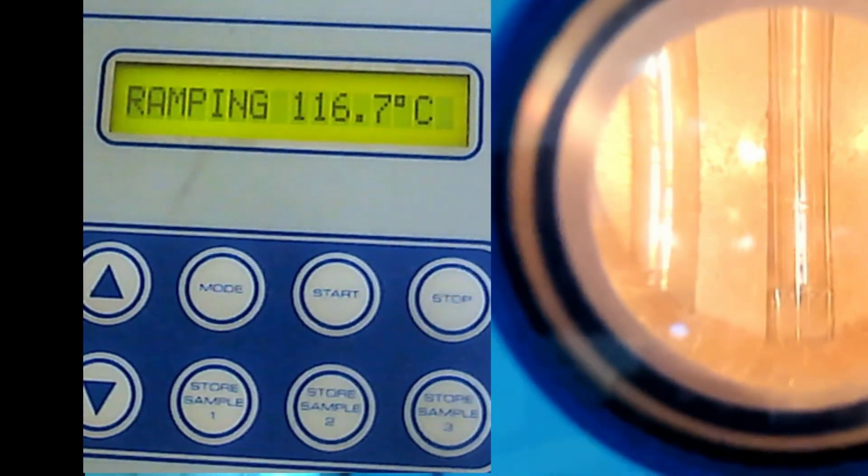If you see it's already melted, I mean the entire thing is already melted. So you need to note down when it starts to melt and when it's totally melted like this. Now put that temperature range in your notes, because that is for your lab report later on. So now we're done with this.